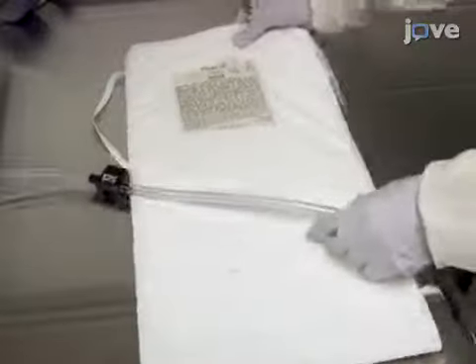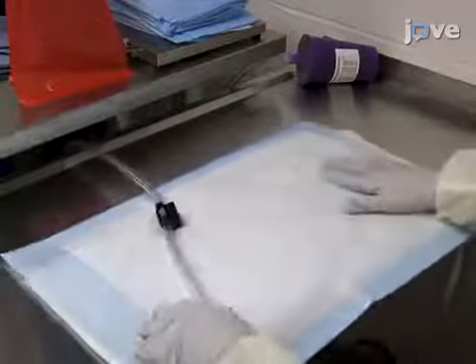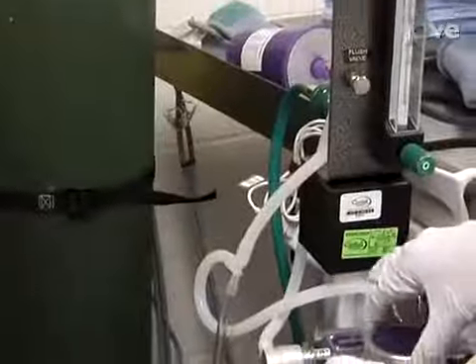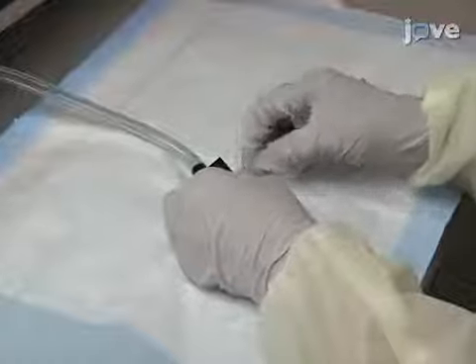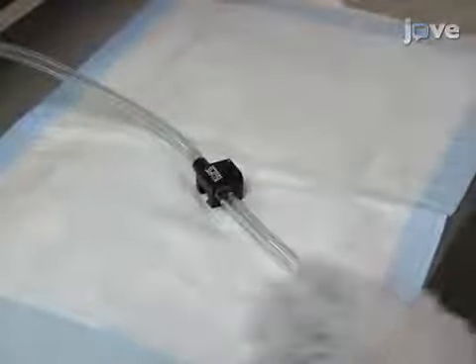Begin by preparing the workstation. First, clean the surface with 70% ethanol. Then place a heating pad in the work area and set it to warm to 37 degrees Celsius. Place a bench pad on top of the heating pad. Check that there is adequate oxygen and isoflurane for the procedure. Clean the induction chamber and anesthesia mask with 70% ethanol, and place the anesthesia mask on the bench pad.